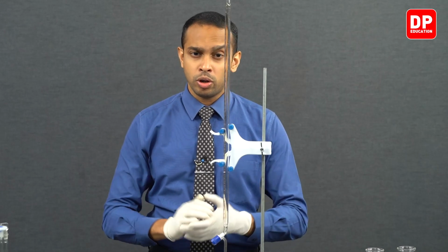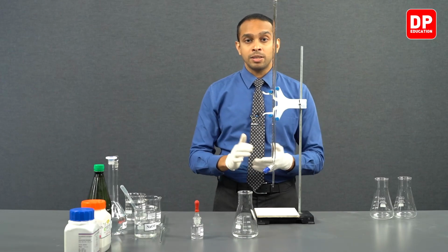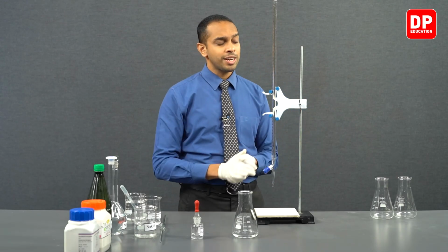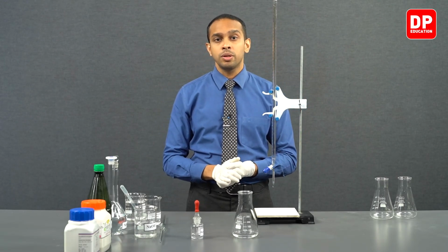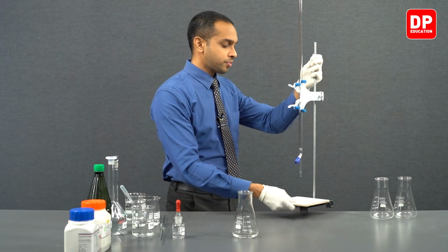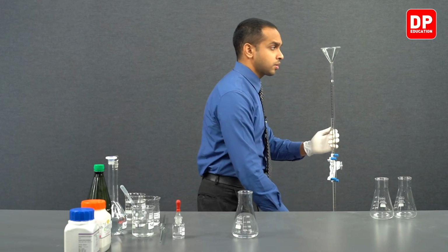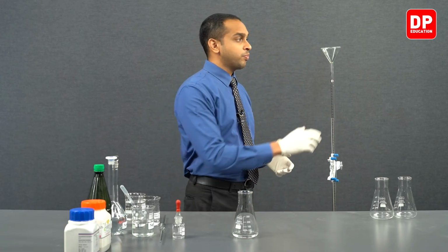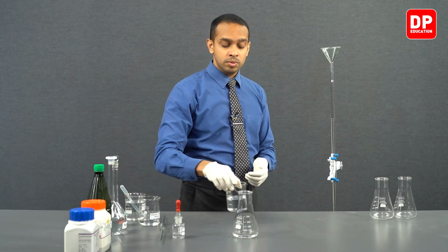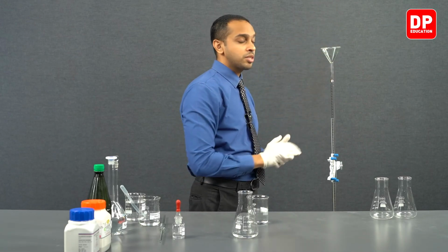into your burette. So in order to do that, you can actually grab a stool and place the burette setup on the stool, and then start filling the burette. So let's proceed to do that. Now let's place this on a stool. Now students, as you can see, you don't have to lift any chemical above your head in order to pour something into this burette.